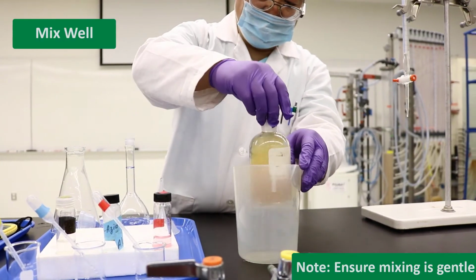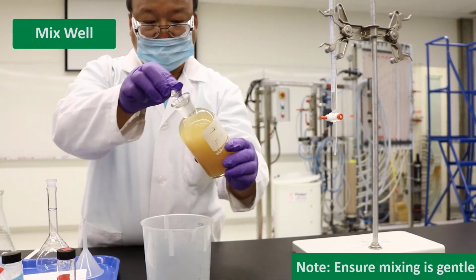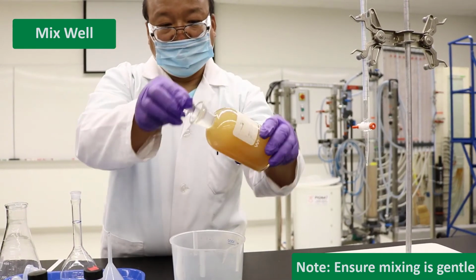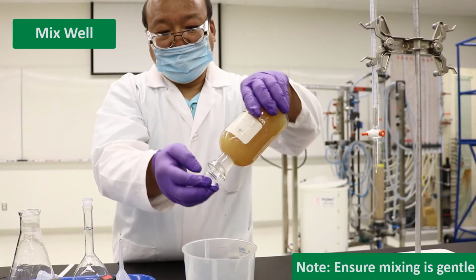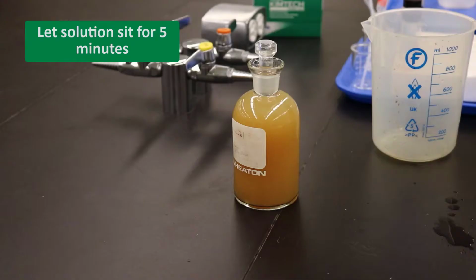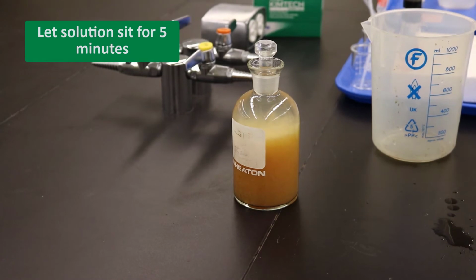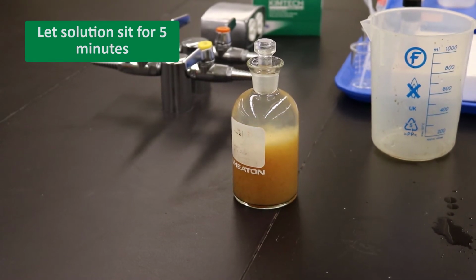Insert the glass stopper and drain off any excess liquid. Mix by inverting several times. A brown precipitate, MnO2, should form if dissolved oxygen was present. Allow the bulk of the precipitate to settle into the bottom half of the DO bottle. This should take about 5 minutes.